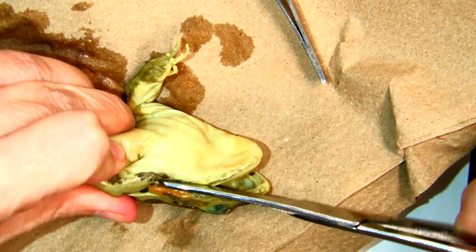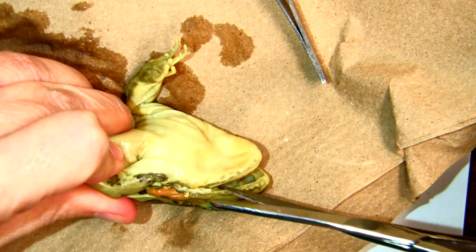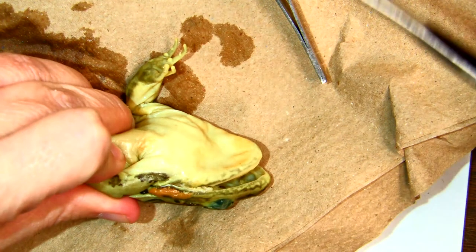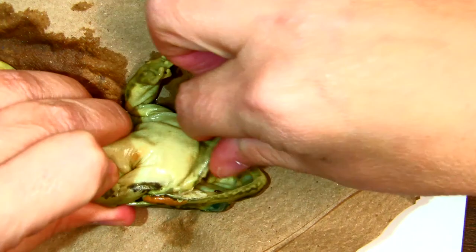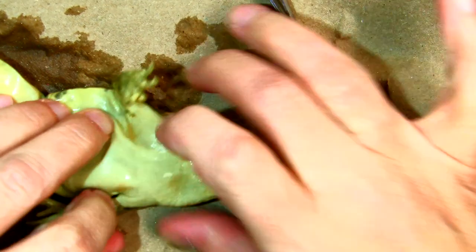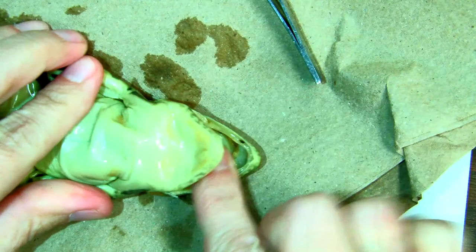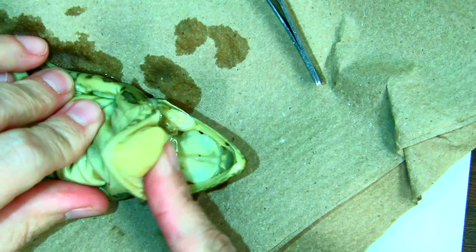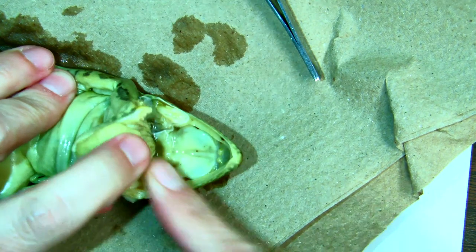It might take a couple of tries and it's going to take a little bit of muscle to open that up. So now that we have broken the jaw on both sides, we can pull down his lower jaw and take a better look at what's inside the mouth.